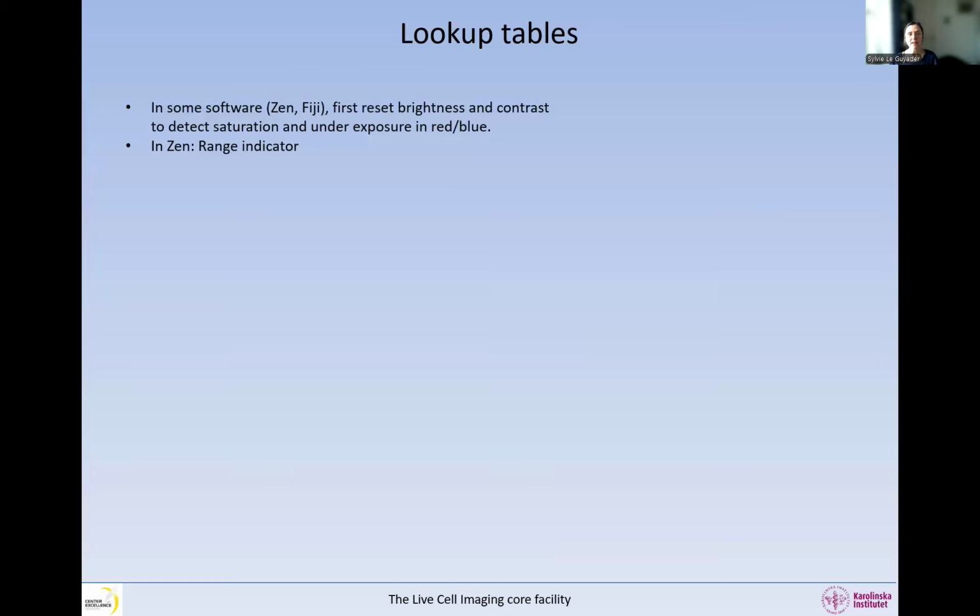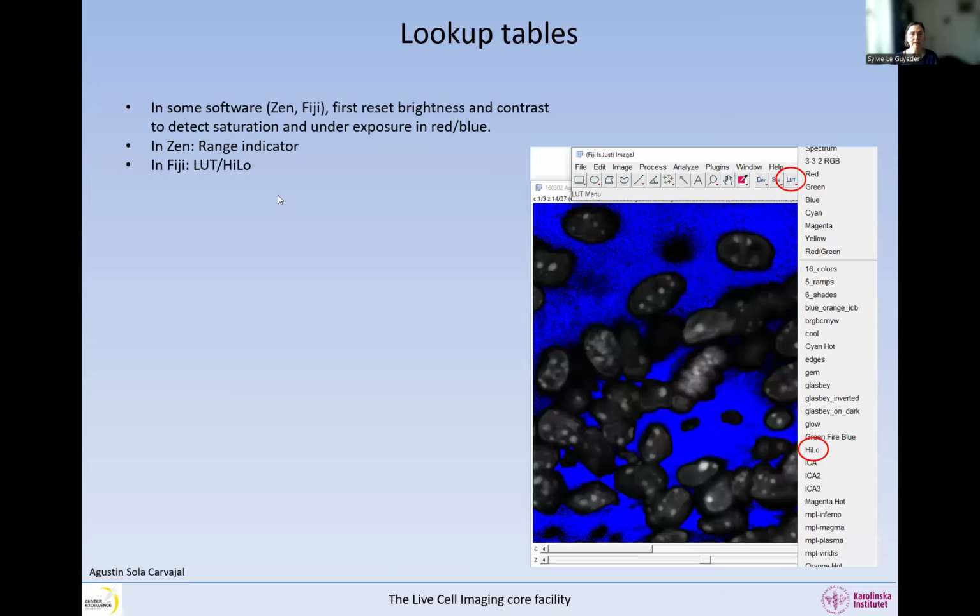So in the Zen software, in some software, you need to first reset the brightness and contrast, so showing all the bit depths available in the image to detect saturation and underexposure. So this is the case in Zen and in Fiji. Whereas in Zen, it's called the range indicator. In other software, you don't need to do that. So it's just a choice of the manufacturer. So it's called the range indicator in Zen, and then in Fiji, it is called HiLo.